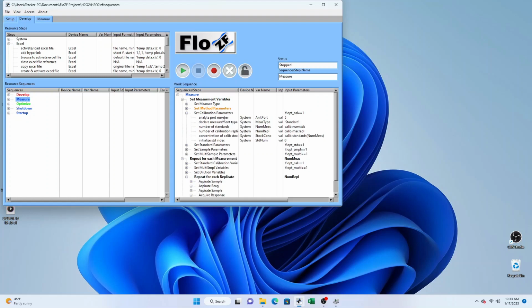In each of these subsequences, we set up various important variables that are needed to do that particular measurement group. So if we're doing a calibration, we want to know which port is the calibration standard set at. In this case, it's port number 5. We want to declare that the measurement type that we're doing is a standard, and so when we get to processing the data, we'll put the data into a calibration table. If here we'd selected sample, then when we get to processing, the data would be calculated to a concentration value based on the calibration table.